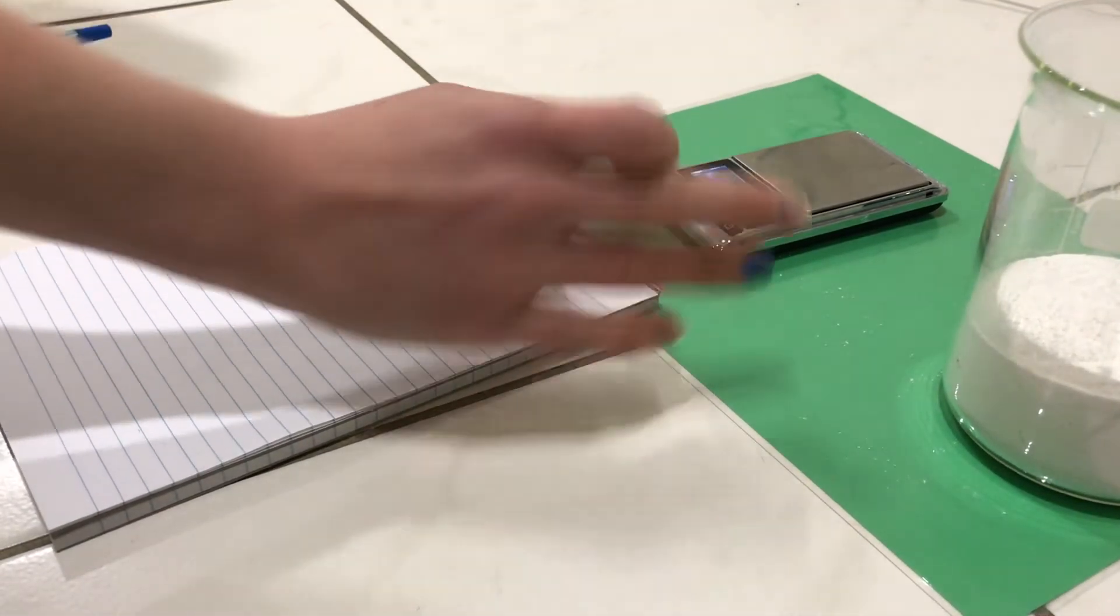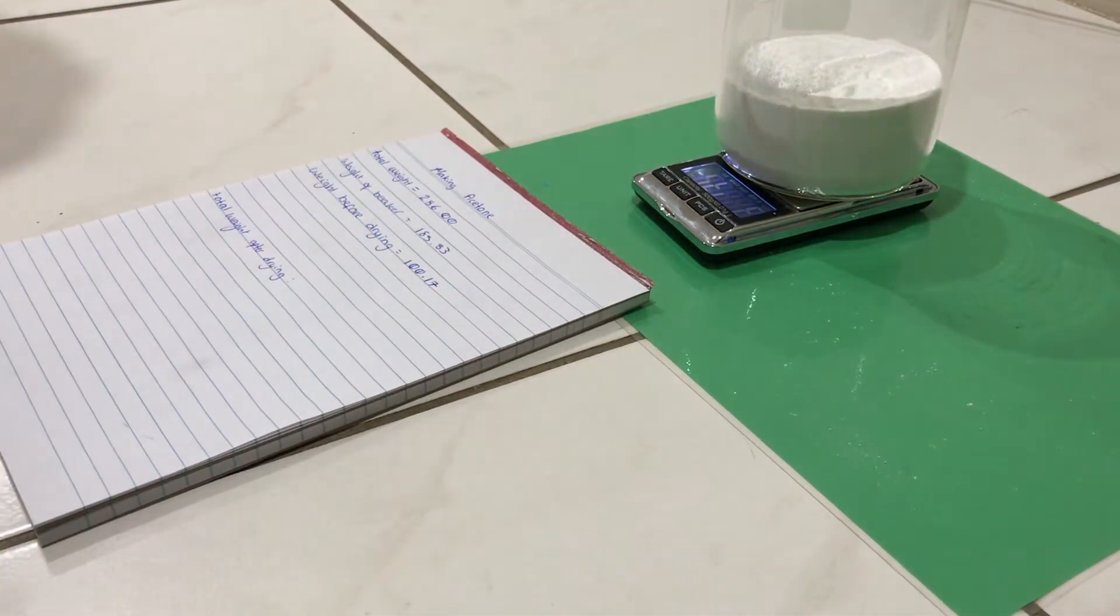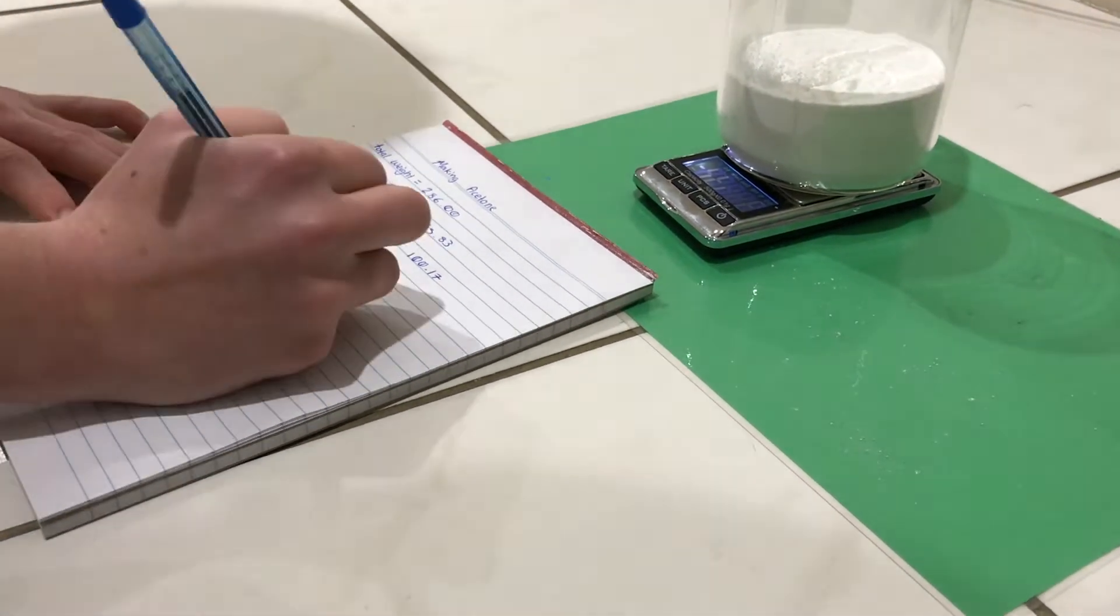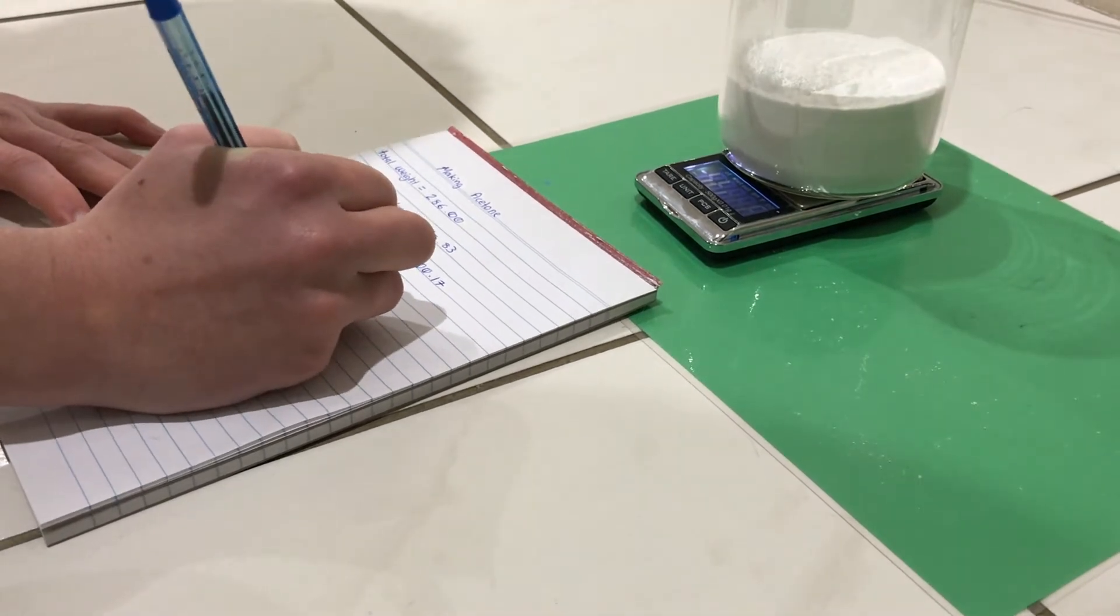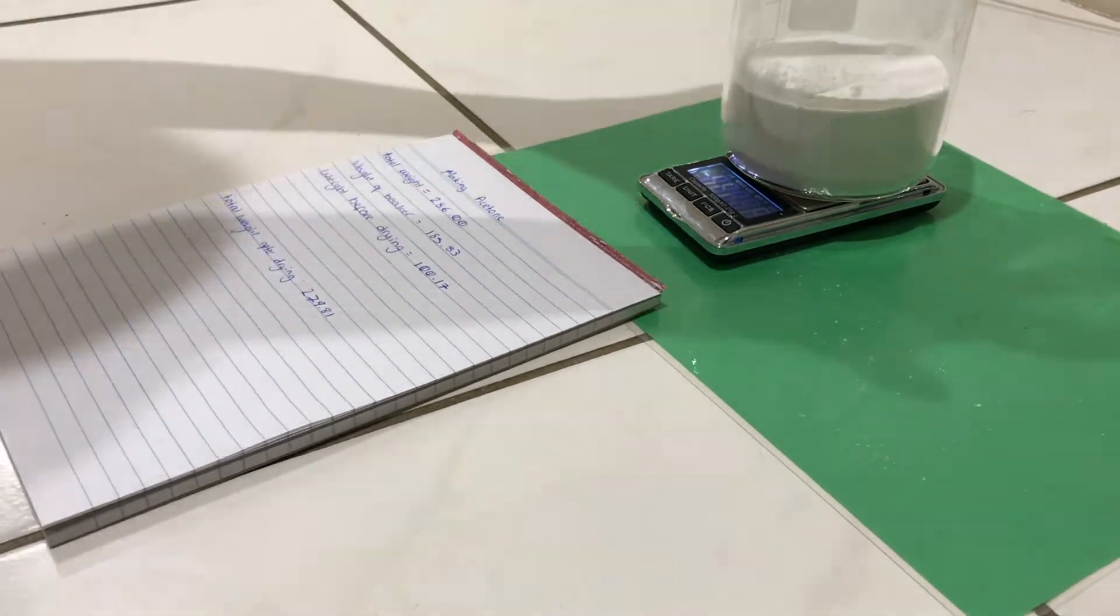Once the calcium acetate came out of the oven, I weighed it again. I did the same process as before, but I cut it out, because who wants to see maths. The total weight after drying is 93.98 grams, meaning that 6.19 grams of water evaporated.